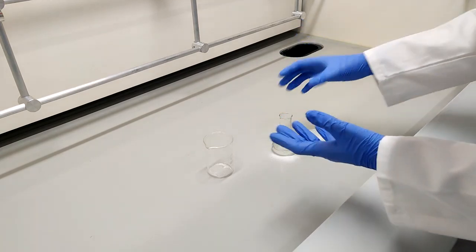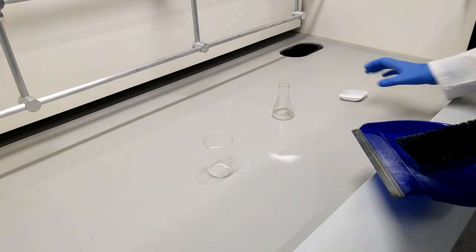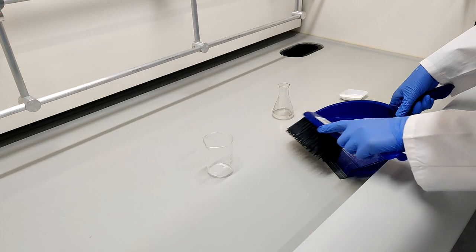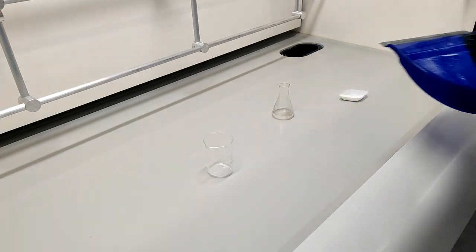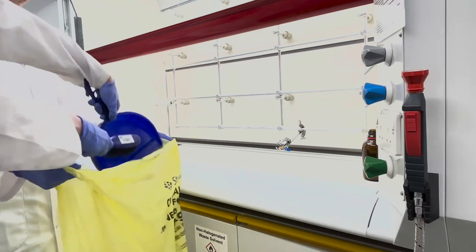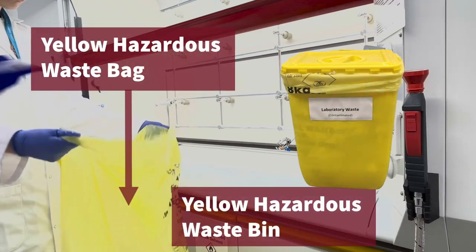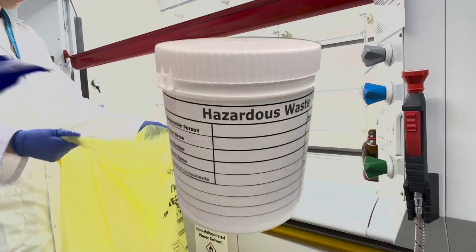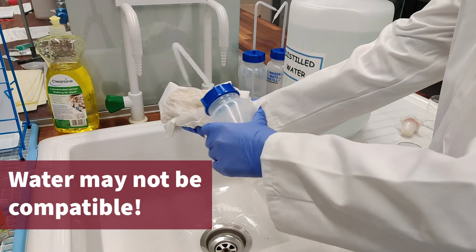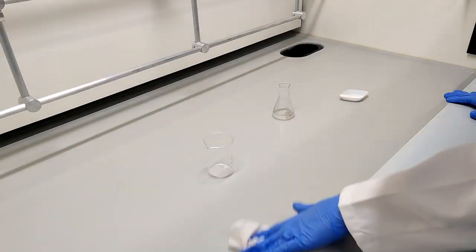To clean up a minor spill of a dry solid, the material should be carefully swept up using the spill kit's dustpan and brush. Once as much of the solid as possible has been swept up, it should be disposed of in a suitable waste container available from the spill kit, which may be a yellow hazardous waste bag or a plastic tub. There may already be a waste container to use in the lab for small amounts of solids. Any excess solid can be wiped up using paper towel damped with an appropriate solvent, which may or may not be water, depending on compatibility.